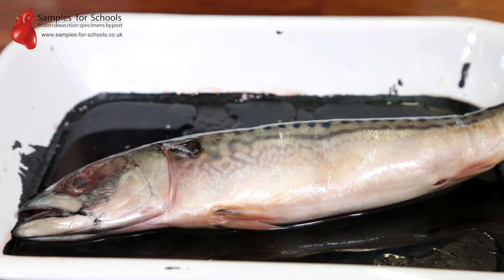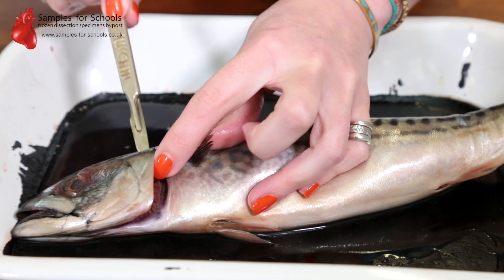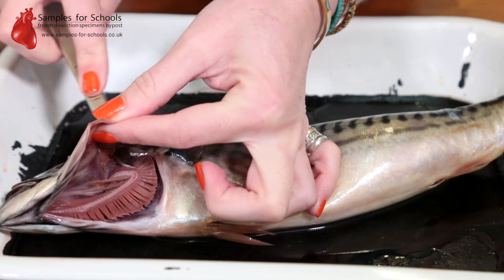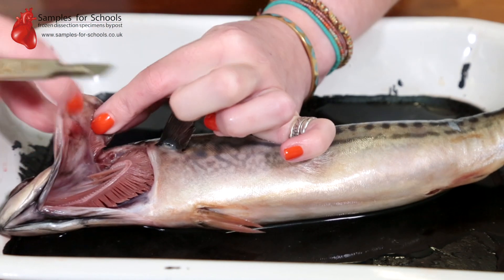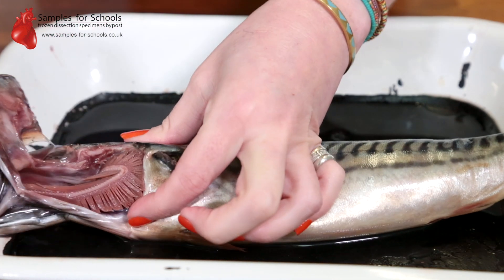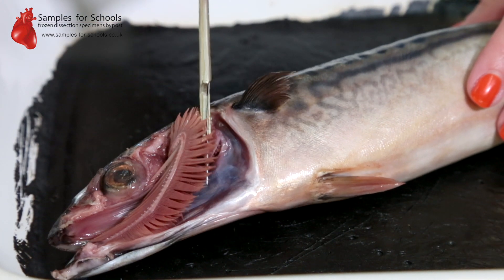To examine the fish gills, we can remove the gill flap, the operculum. This can be done simply by cutting down with the scalpel. Once the operculum has been removed, we can see the full gill structure underneath.